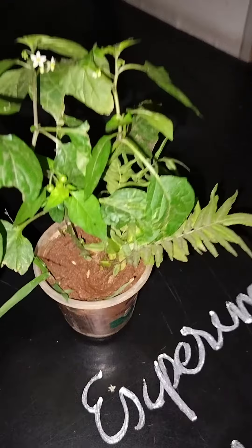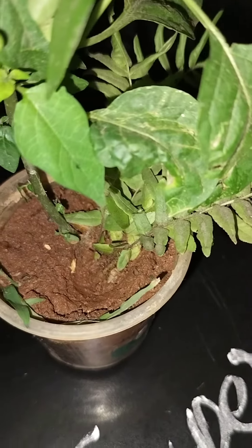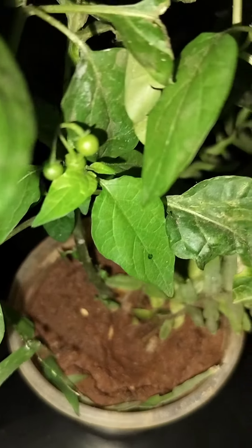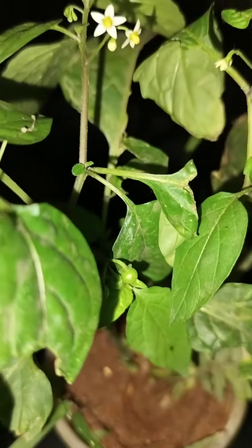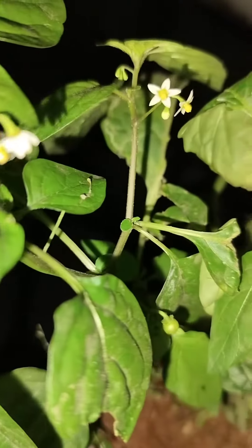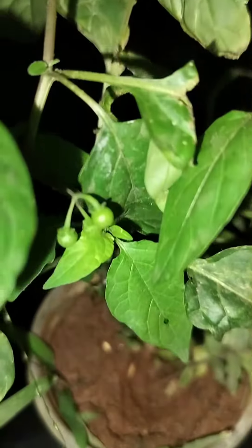You can see the vegetative characteristics of the root, stem, and leaf, and also the floral parts of the buds as well as the seeds.